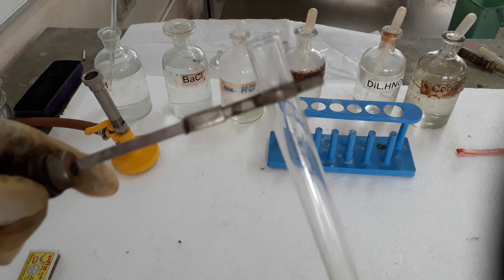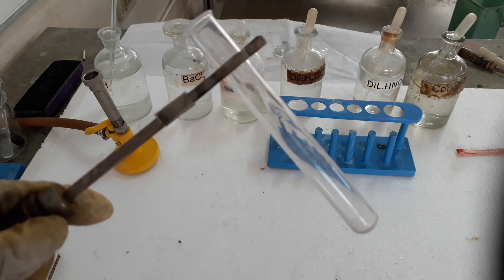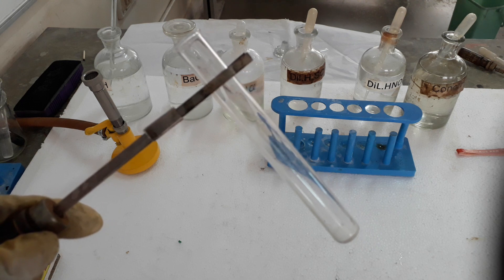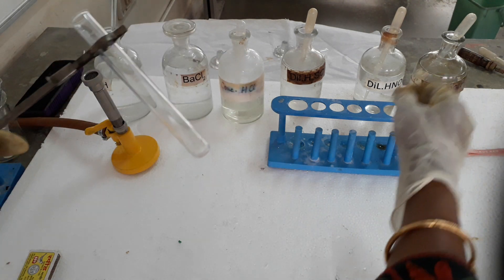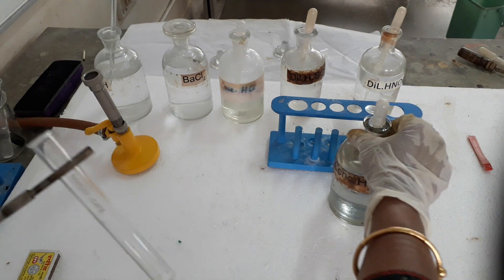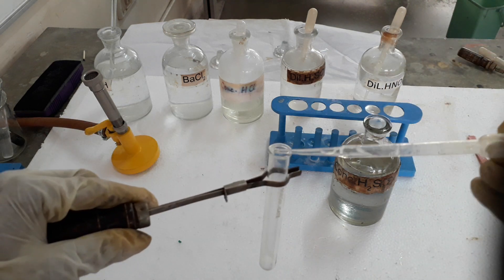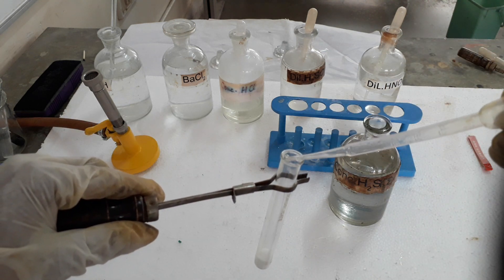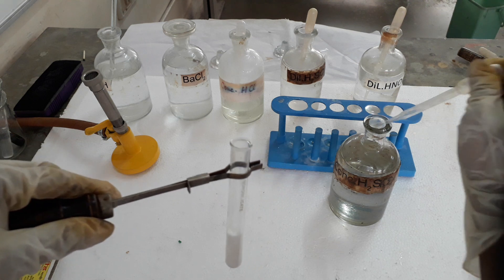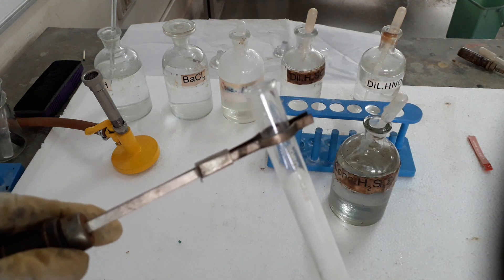Hello students. I will show you now the test of hydrogen chloride gas. For that I have taken sodium chloride salt, and we will add concentrated sulfuric acid. When you add concentrated sulfuric acid, what will happen: NaCl plus concentrated sulfuric acid will give you hydrogen chloride gas.